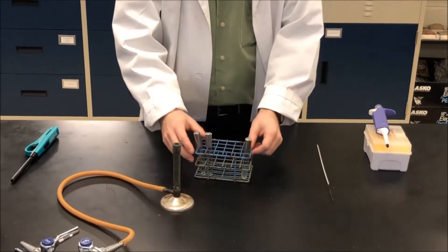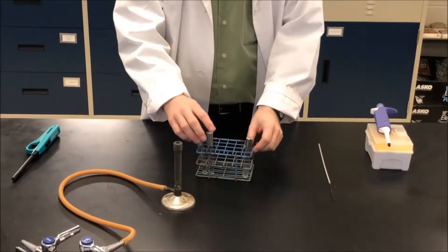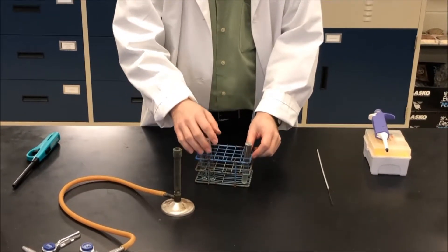In this video, we're going to show you how we can inoculate liquid cultures of bacteria.